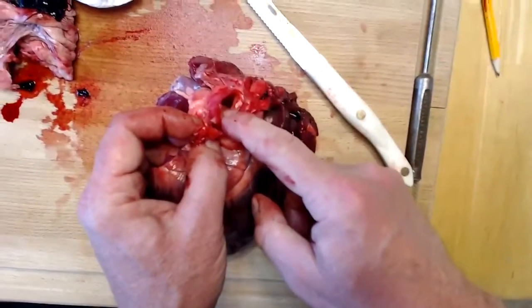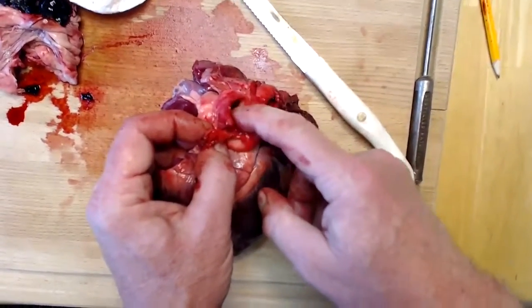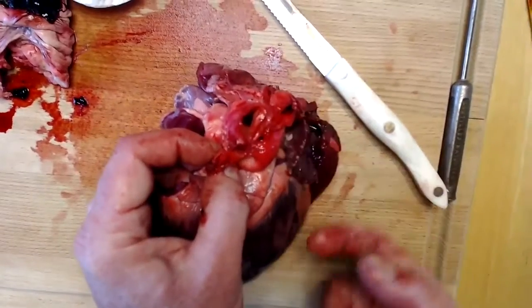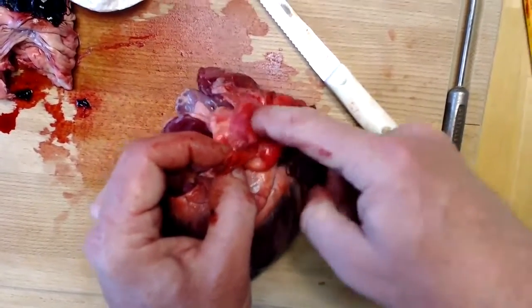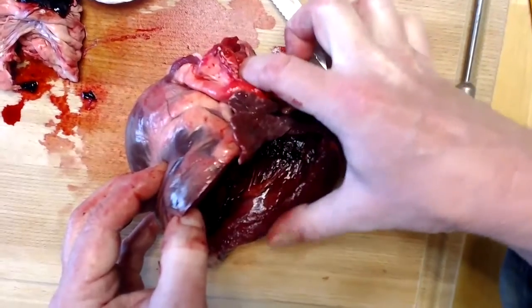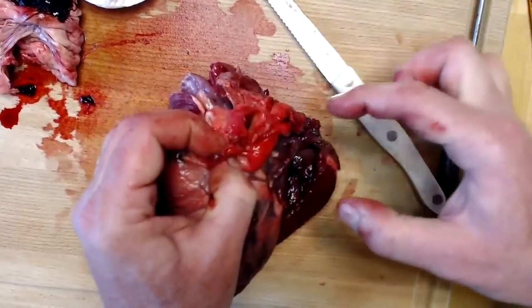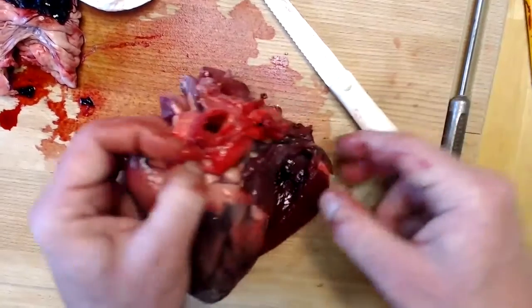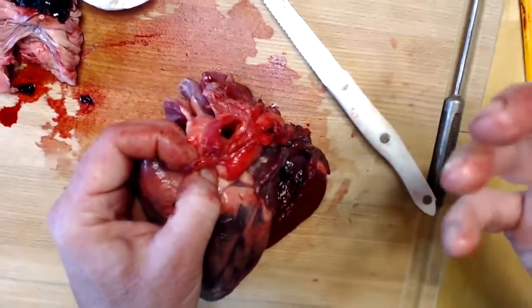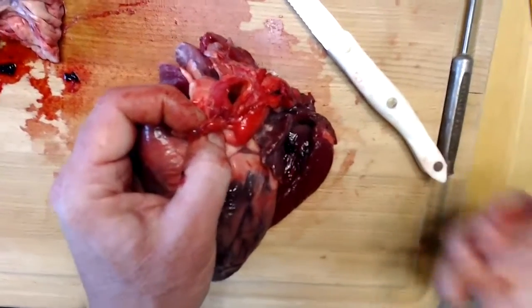The collagenous fibers are there to provide strength and rigidity to the wall of the blood vessel, and the elastic fibers are there to stretch, because remember, blood coming from the left ventricle is being pumped under a great deal of pressure. Remember, the wall here is thick. It's thick because it needs a great deal of pressure to pump the blood through the systemic circuit. Remember, on the right side, it was going through a rather short distance to the lungs, so it didn't have to be pumped under as great a pressure.